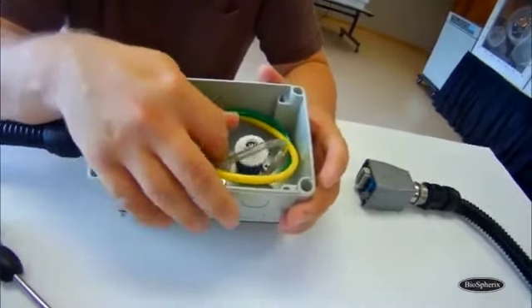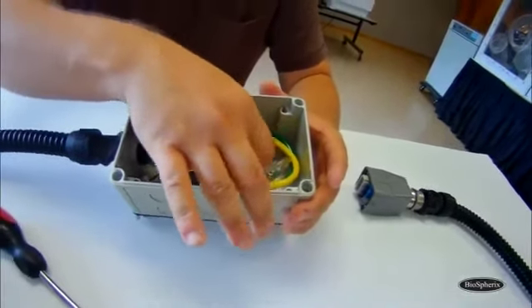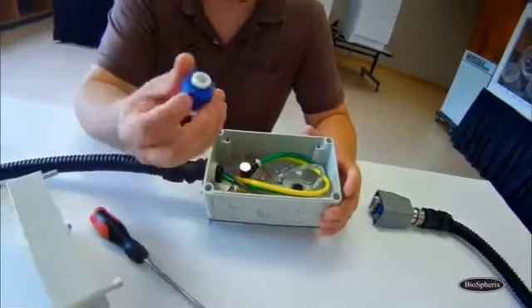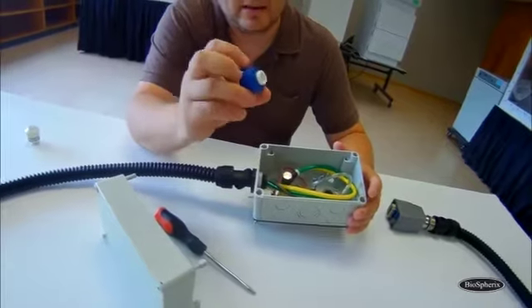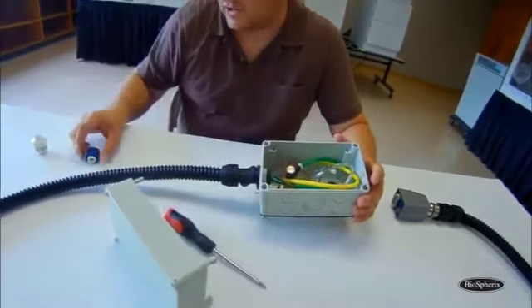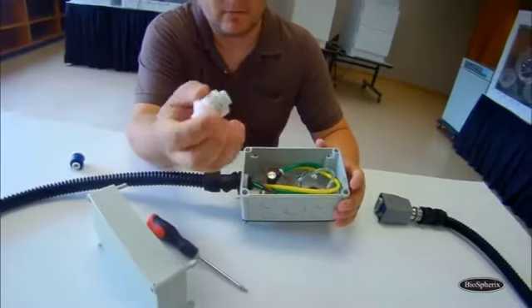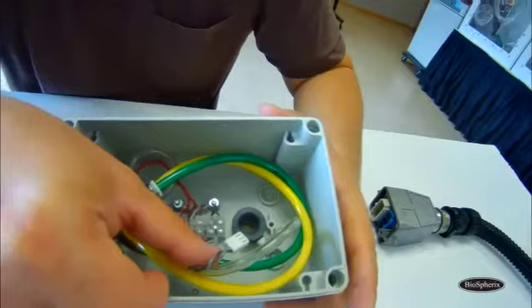able to be accessed, and then you just unscrew it by hand. Just turn it counterclockwise, and it pops right out. I have a piece of blue tape on this just marking the date that it was put in, but it looks just like your replacement one. Everything will be white or clear. And you can see this is the housing it sits in.